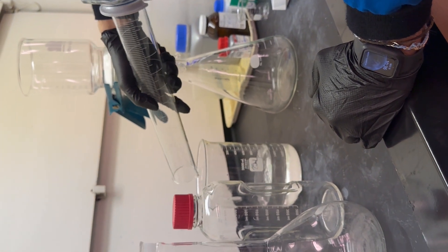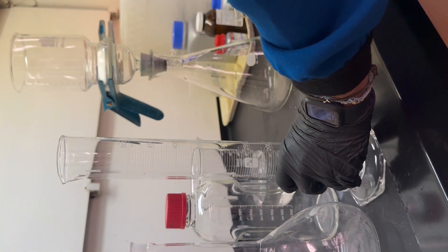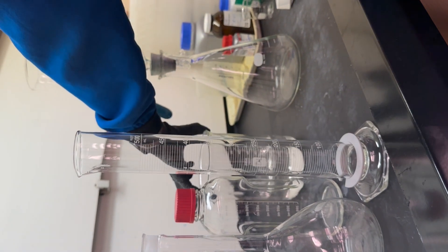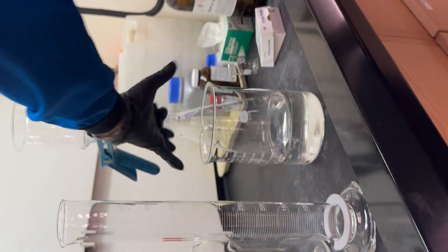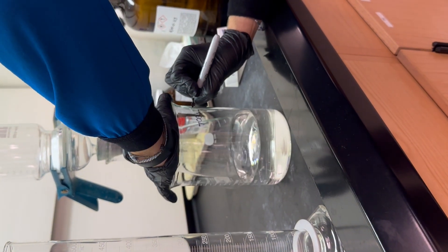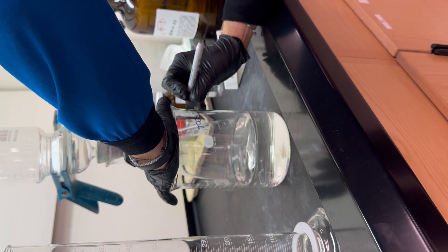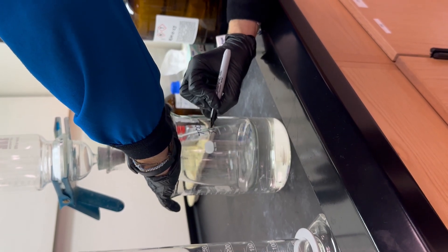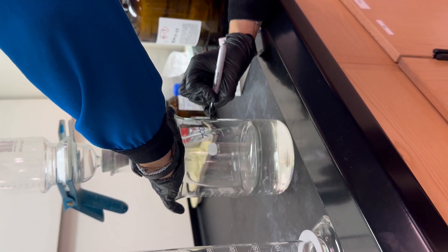We currently have 70% acetonitrile in here, make sure we document what's in here. Then we'll be adding our 300 mLs of our water.